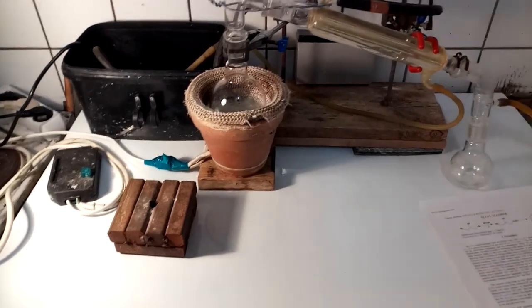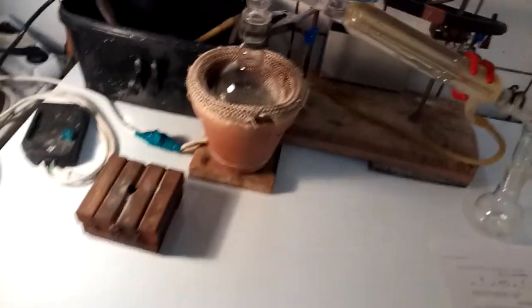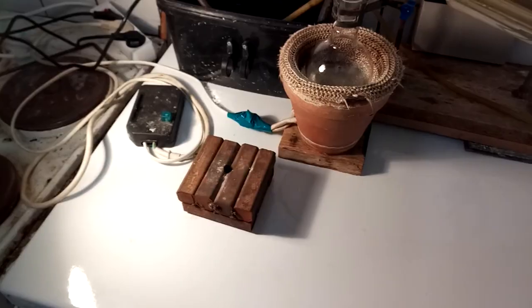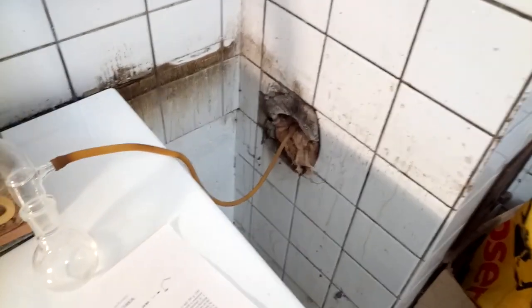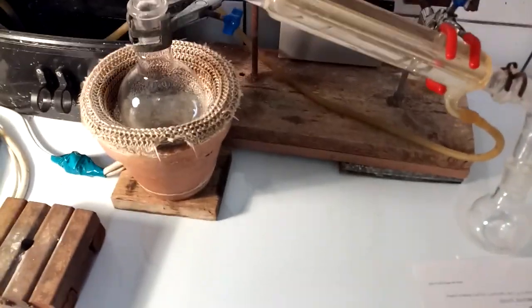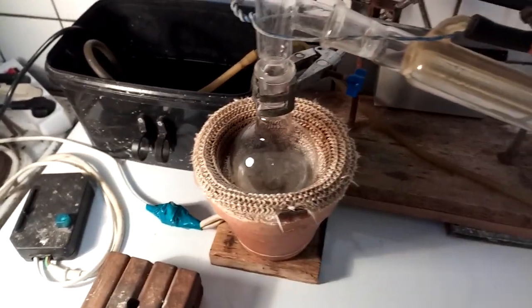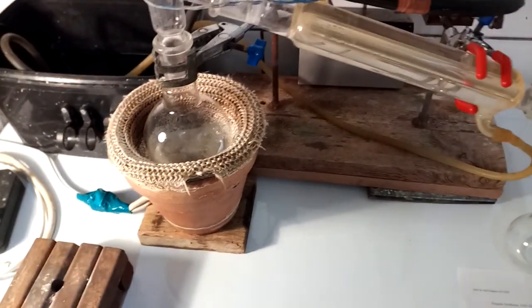I should mention that obviously I'm leading the toxic gases this may produce outside. That's also why I'm working on this surface here — normally I work on the other side of the lab, but I don't have an opportunity there to pipe out the gases. This here is actually an old wood stove that used to be connected to the chimney, and I'm just using that to pipe out the gases. Also, quite an important part of this reaction is temperature control.